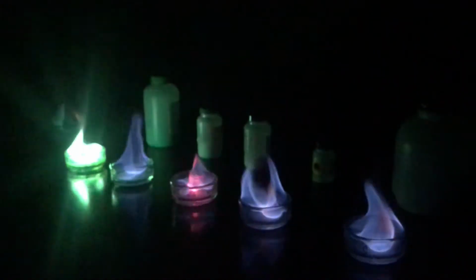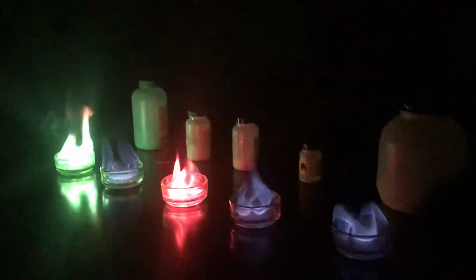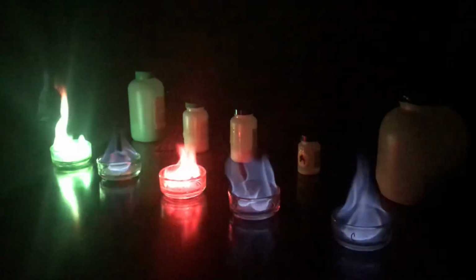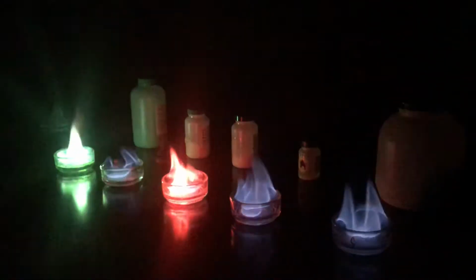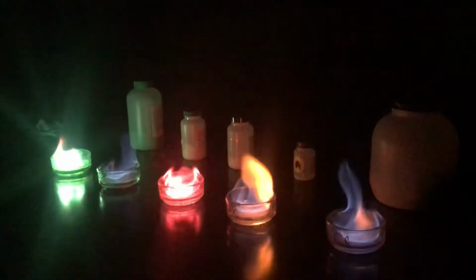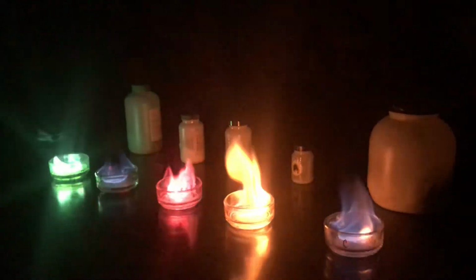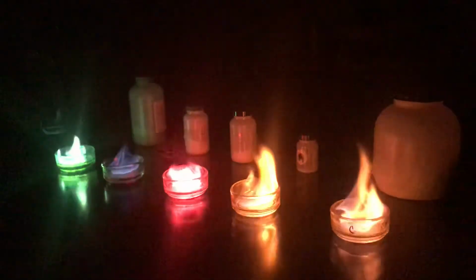What this is giving us evidence of, remember, is that electrons don't all just exist floating around in the same orbitals. There must be these little sublevels of different amounts of energy, and each atom is slightly different from the one that it's close to on the periodic table. And this gives us some evidence that those differences exist, and that's why we have to do electron configurations to map out where those electrons would normally exist.